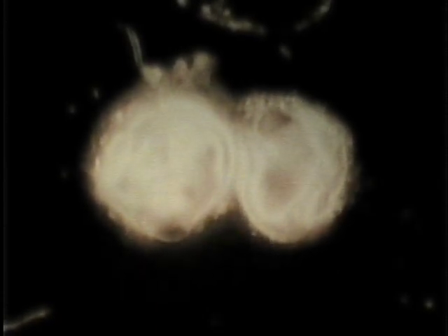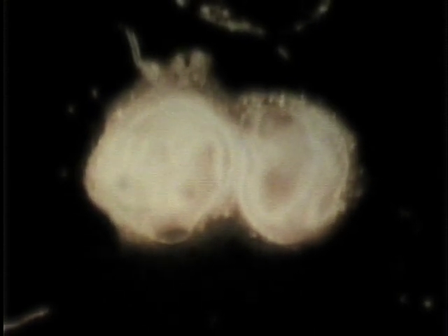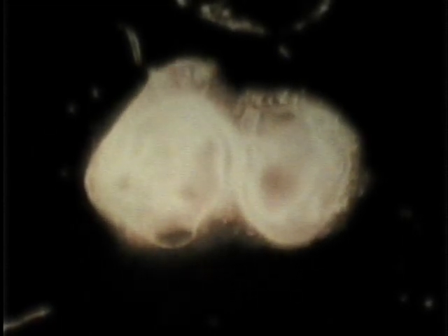A series of experiments have shown that as early as the 11th day of gestation, each portion of the otocyst has already been programmed to form specific sensory structures of the inner ear. At the end of 5 days of growth, there is on the left a labyrinth consisting of only 3 semicircular canals and their ampullae. On the right, there is a labyrinth which contains only a cochlea and its ganglia.